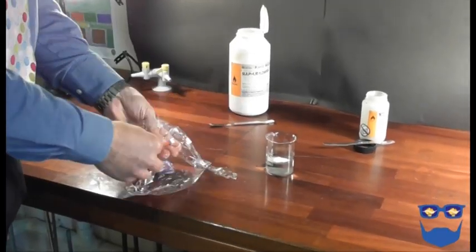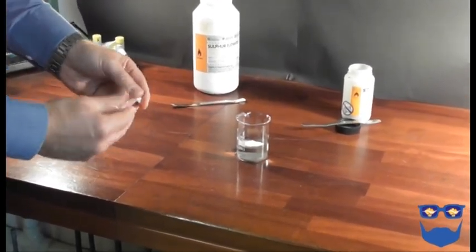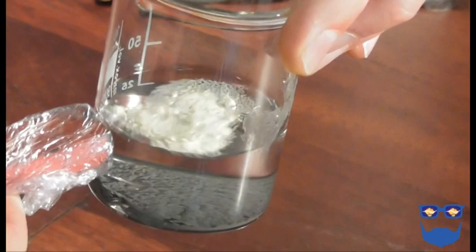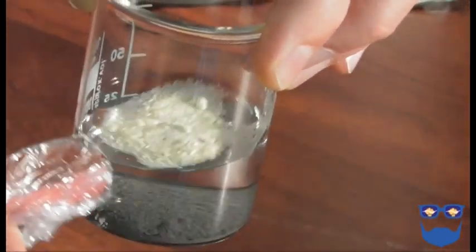Wrap a bar magnet in cling film and try to manipulate the iron and sulfur inside your beaker. The students should record their observations.